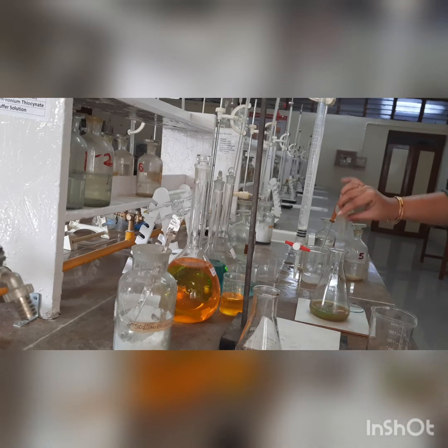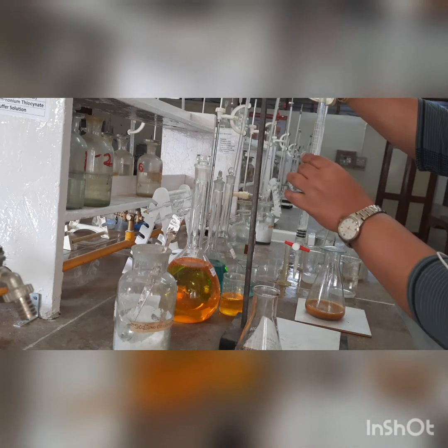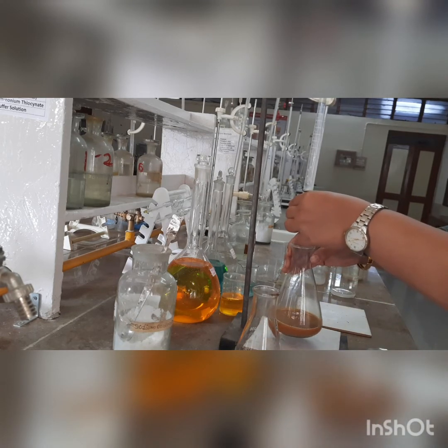Add a little glacial acetic acid and swirl — you will observe that the solution has again turned clear. Now it is ready for the titration. We are going to add our KI — 10 ml of 10% KI. As soon as we add KI, we close the lid of the conical flask. In this solution, we have added sodium carbonate before — this is done just to neutralize the mineral acid present in the copper sample. We have covered the sample and are going to now titrate. The burette is refilled to zero mark. Again, we are not adding the indicator initially — we are going to wait for the solution to turn pale.